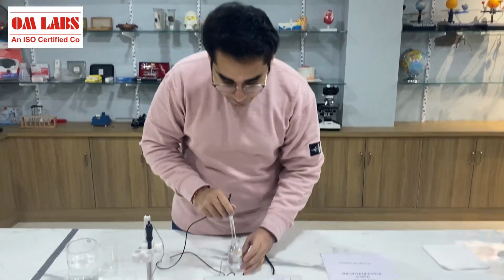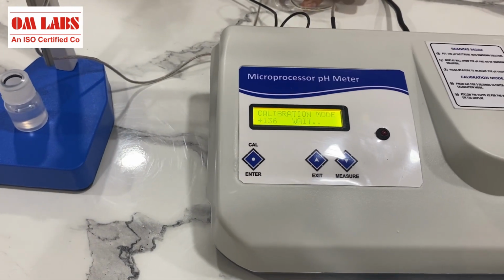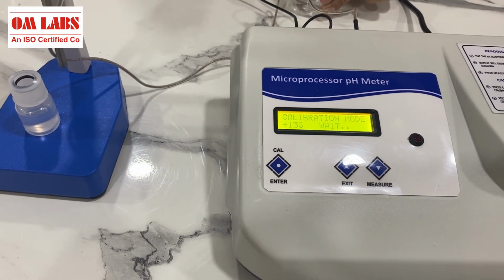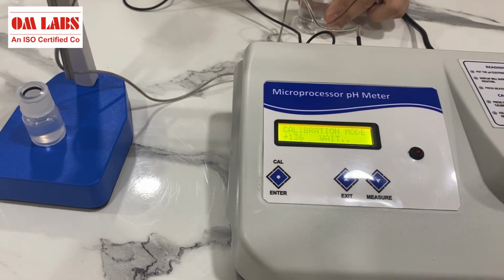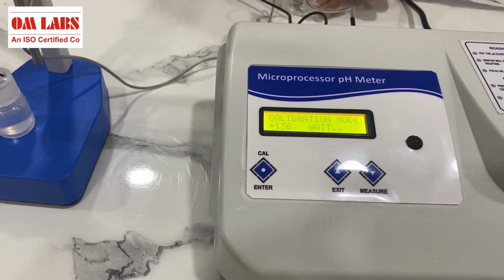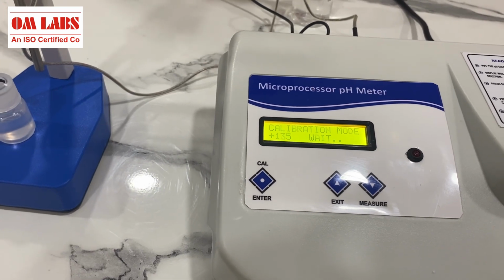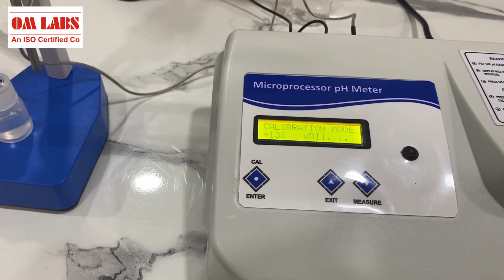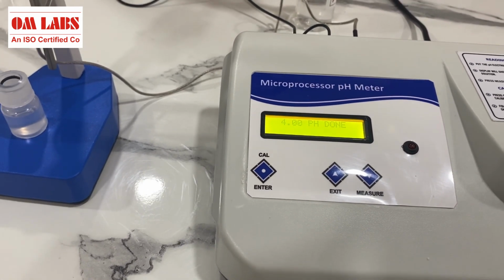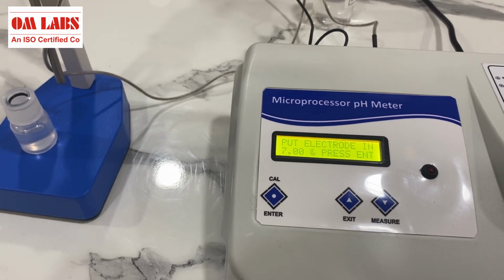Now as I immerse it, I'll press enter, which is the same as the cal button. I press enter, and now it is asking me to wait till the calibration gets over. As you can see, the calibration with buffer solution on pH 4 is done.